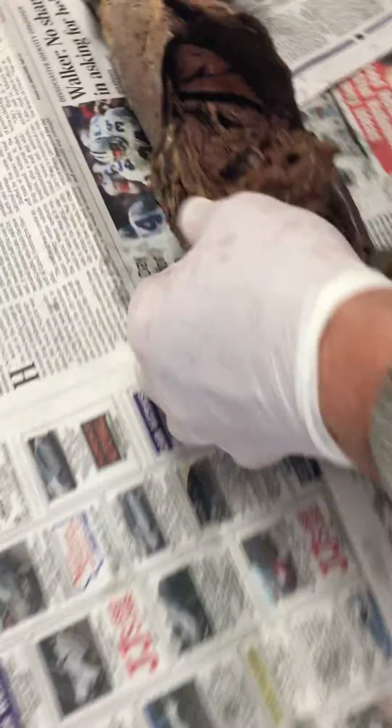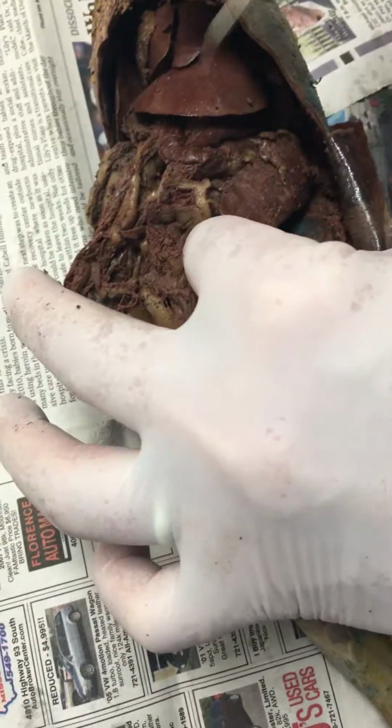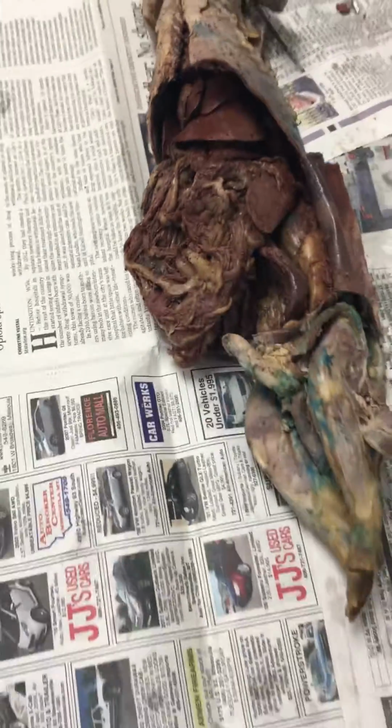The greater omentum is your fat storage organ. When you lift the greater omentum up and look on the other side of it, that's the spleen here. It looks kind of like your liver, but it's not. It's attached to the greater omentum. That's the spleen. When somebody cut that, I don't know if we have a spleen or not. They cut your greater omentum off, so we never saw that.